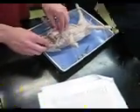Salivary glands are in there. All right, let's go deep in there. Excellent, Dr. Burton. Excellent. Thank you.